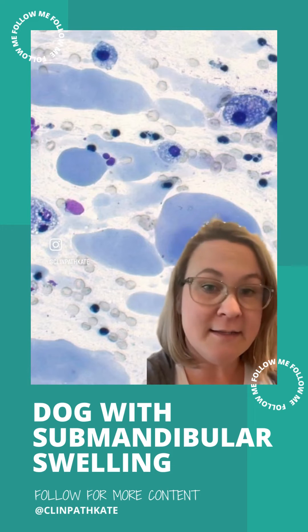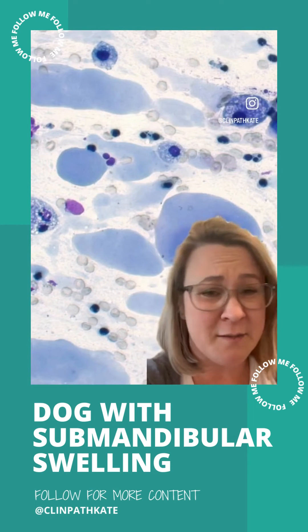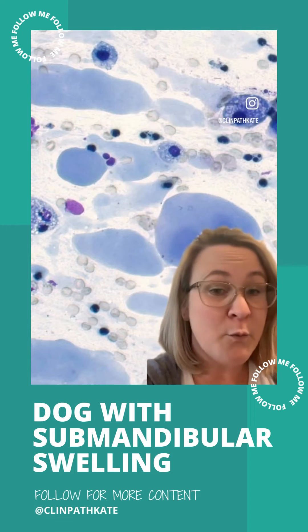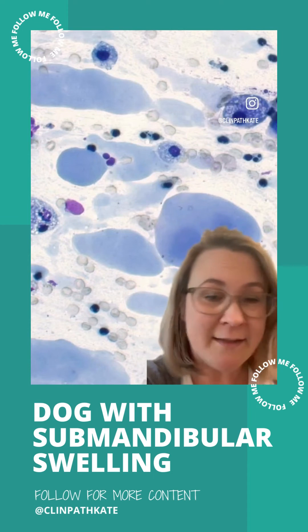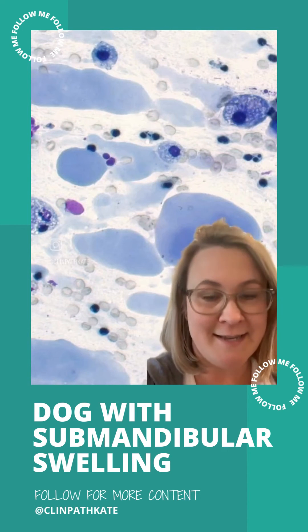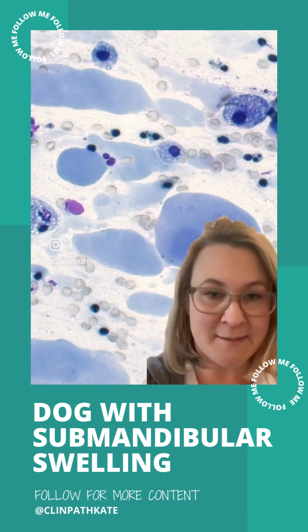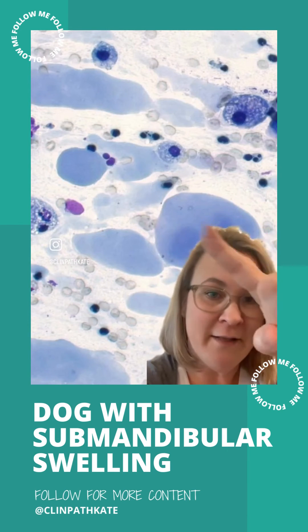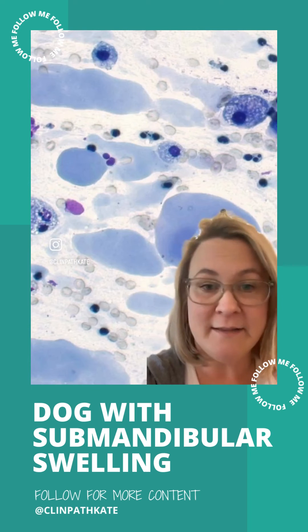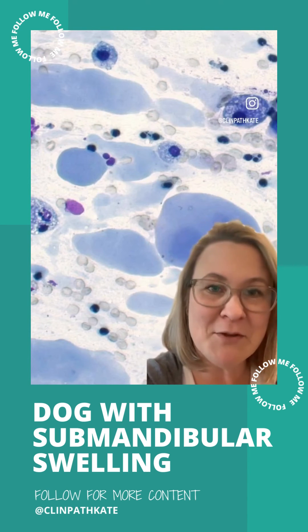That happens when we are dealing with a viscous material — it's called windrowing — and it is seen with things like joint fluids, saliva, and some tumors that make viscous material. Correlating this all together, in this location, this is a salivary mucocele. Saliva is viscous, which explains the windrowing. This saliva is free in this space, which it shouldn't be — that makes it a salivary mucocele.